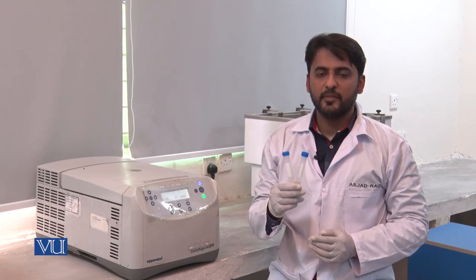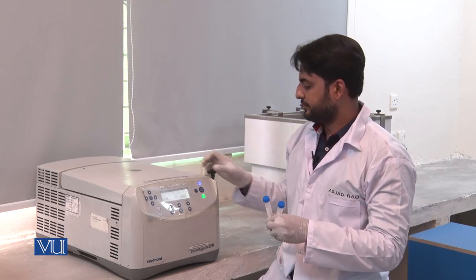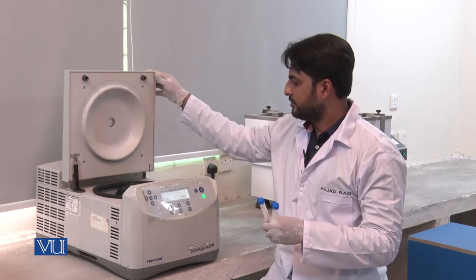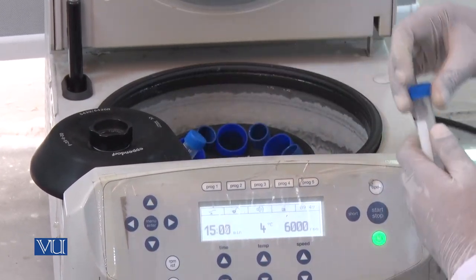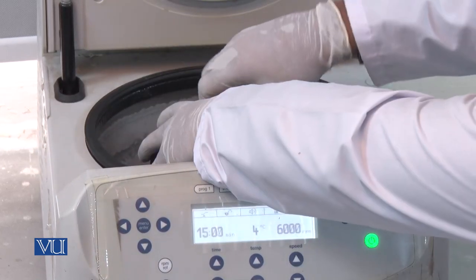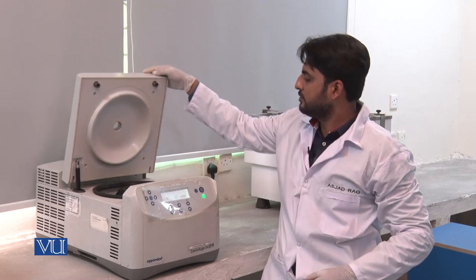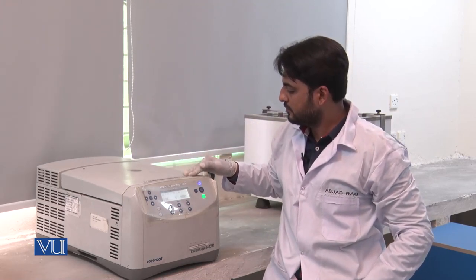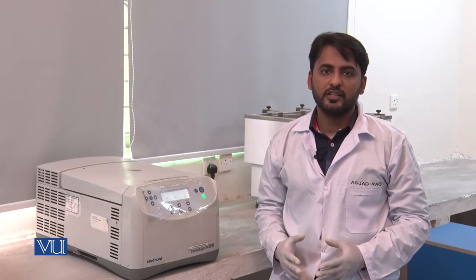I have taken 10 ml of inoculated media in these two different falcons of 15 ml capacity for centrifugation. Now I will put these falcons in the centrifugation machine. As centrifugation has started, we will wait for the completion of the centrifugation time. As the centrifugation time has been completed, we will now take out our falcons from the centrifugation machine.